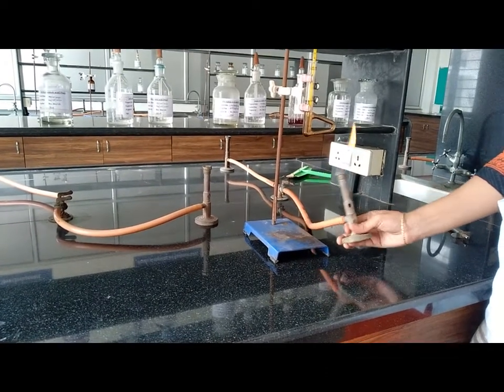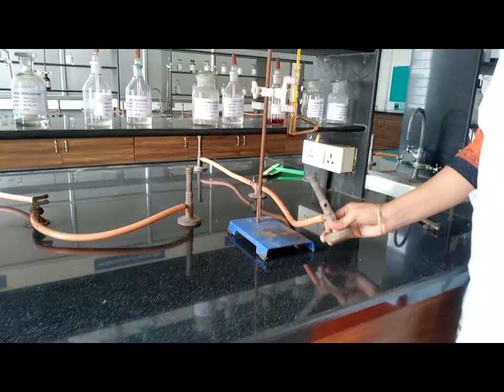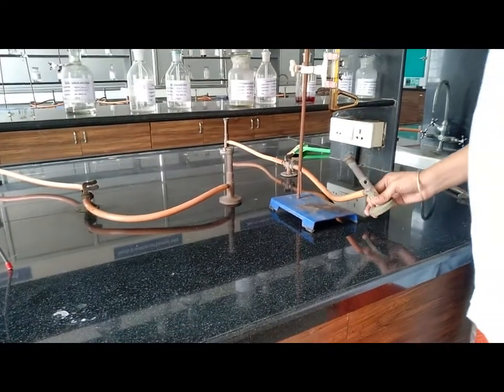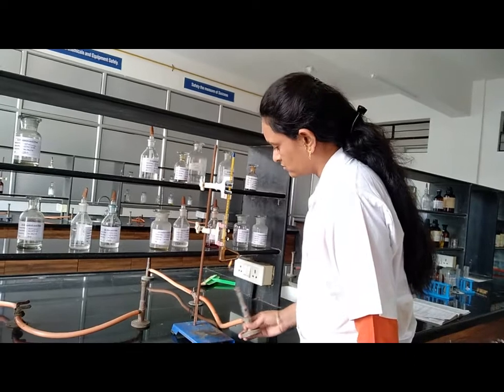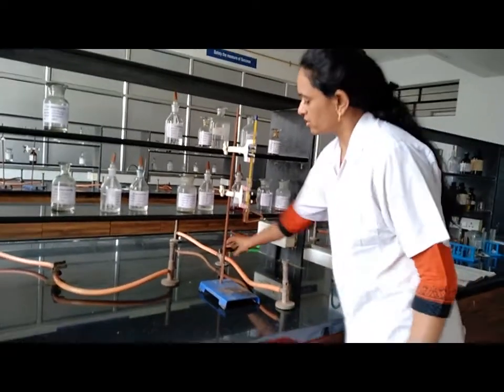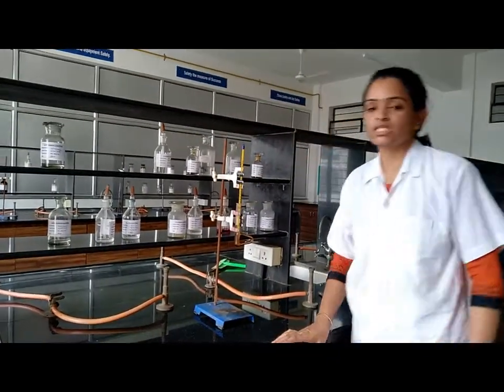When the solid compound slowly converts into liquid form, stop the heating and immediately record the observation. The compound begins melting and the temperature reaches 165°C. At 169°C the compound is fully melted, meaning Sulfamethoxazole has a melting point of 169°C.